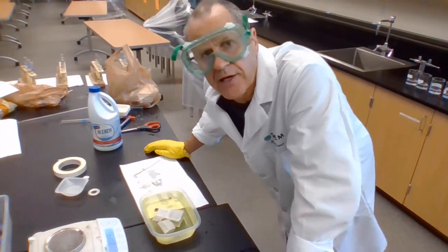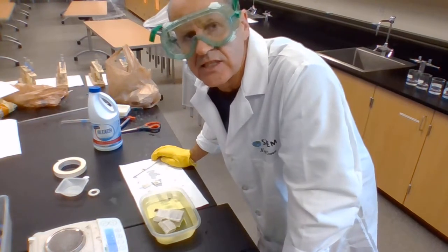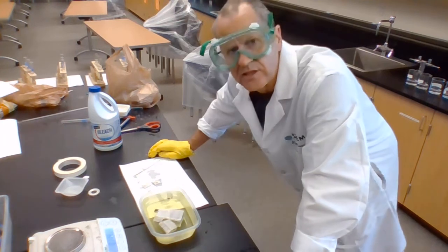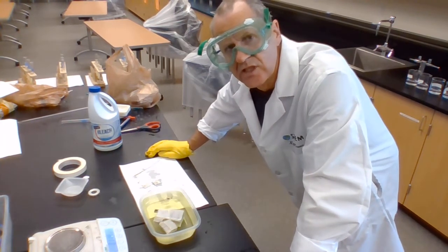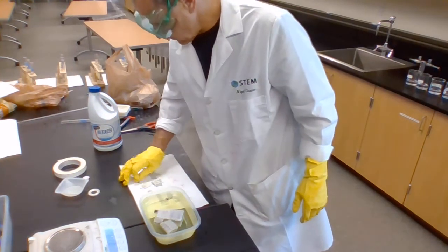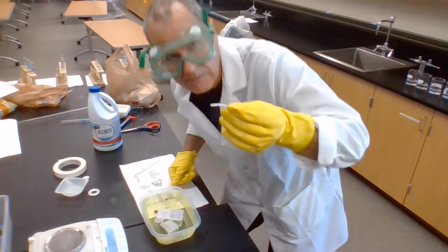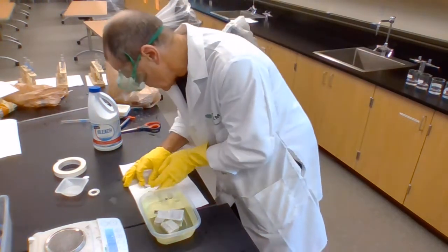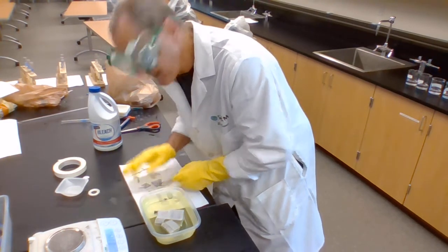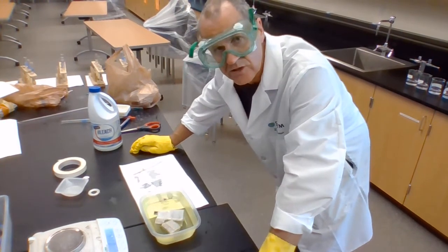So let's now have a look how the diffusion has gone in our cells of different sizes, shapes, and therefore surface area to volume ratio. What I'm interested in this lab is the diffusion distance. Before, when we left these things for a very short time, the bleach had diffused around about 1 millimeter into the structure, and therefore a very low diffusion distance was an advantage if they actually wanted bleach.